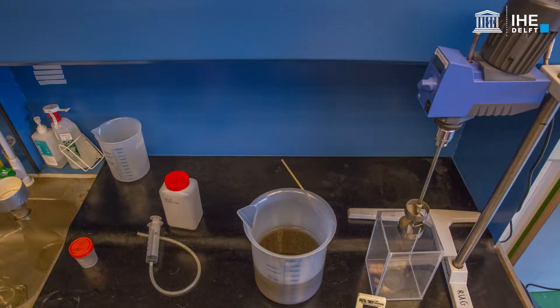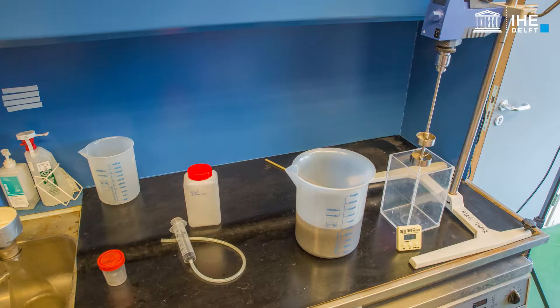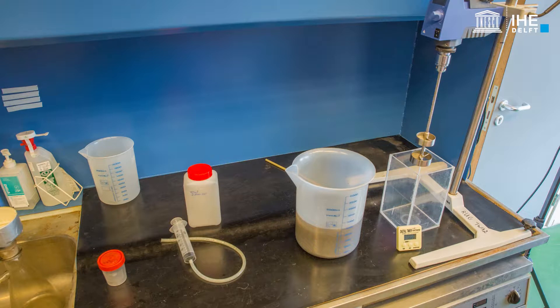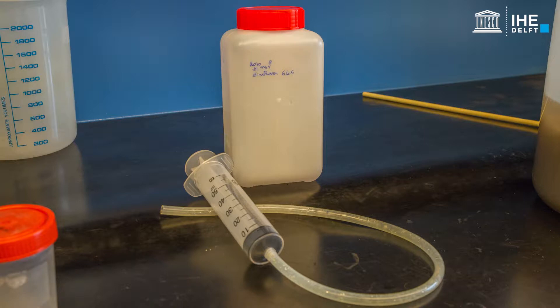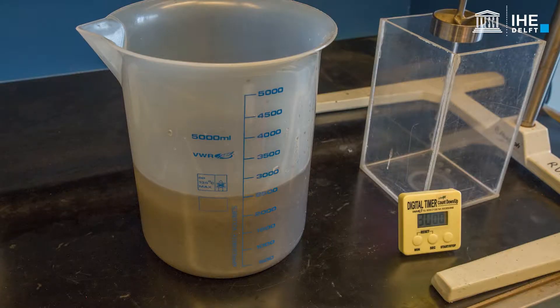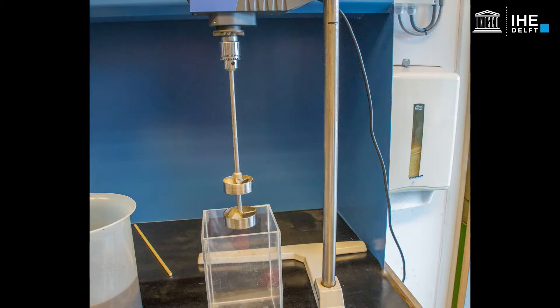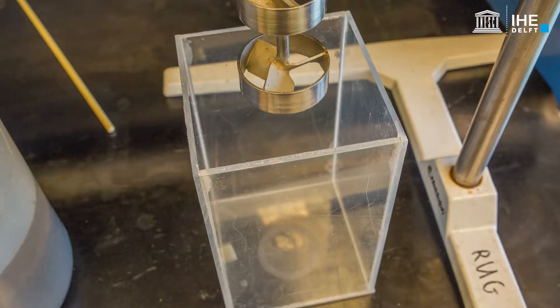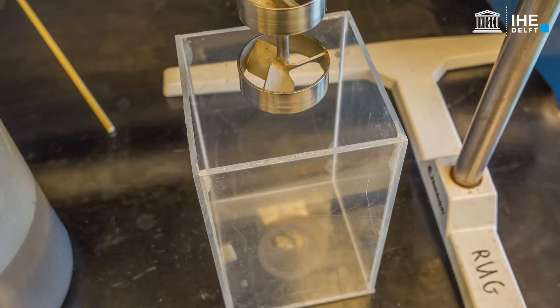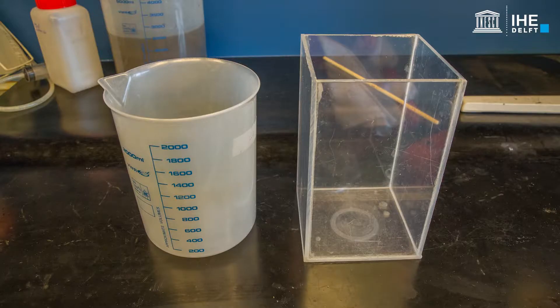An FSS test quantifies the flocculation potential of a sludge sample by measuring the concentration in the supernatant after 30 minutes of settling under ideal flocculation conditions. Flocculation is maximised by mixing the sample for 30 minutes prior to settling. Settling is performed in an ideal settling device. It is important that the jar is square to avoid the formation of a vortex during mixing.